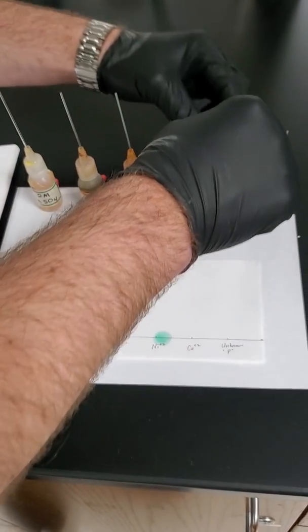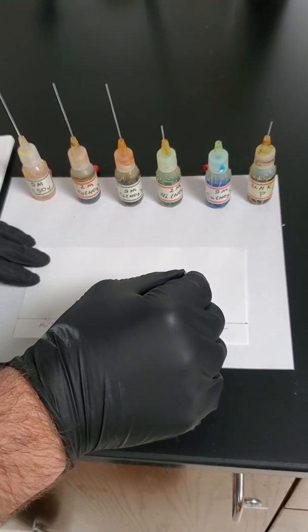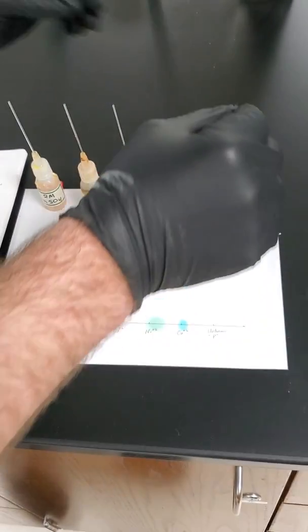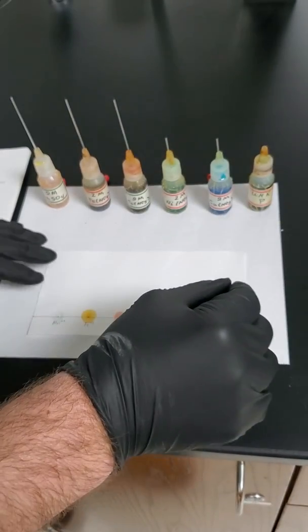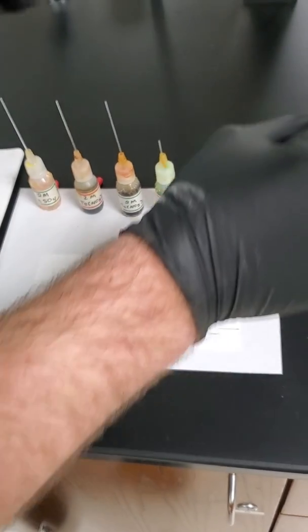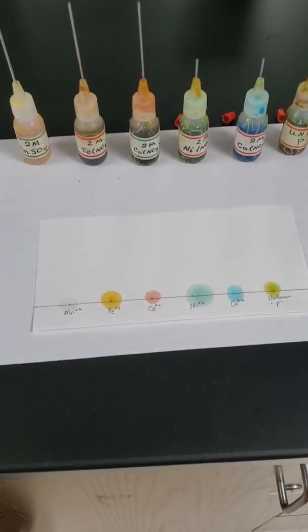Got lucky on that one. And lastly, our unknown. Guys, 2 of those 5 to have to deal with.